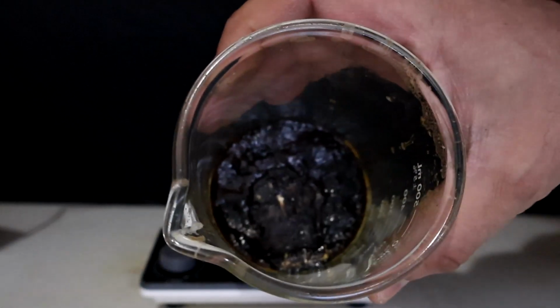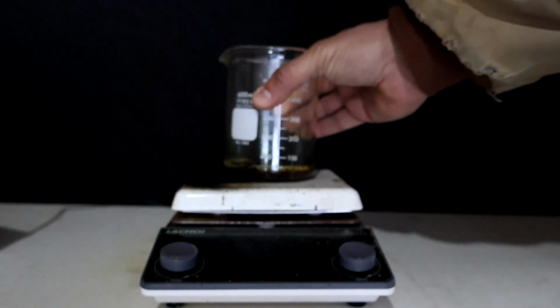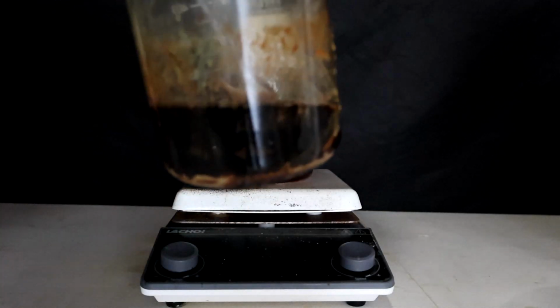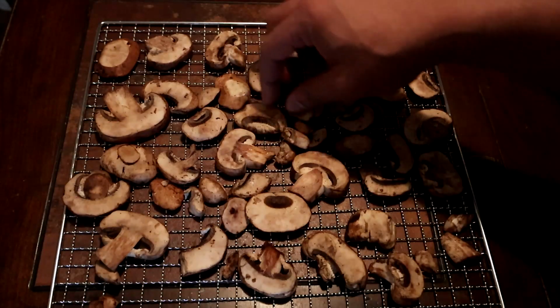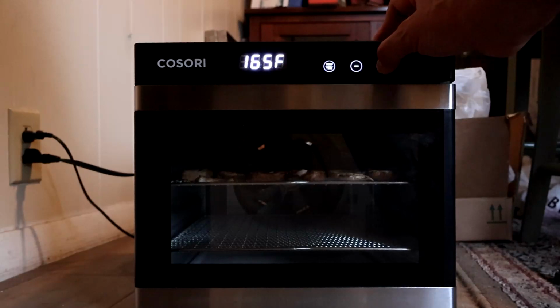This ugly organic carbon goo was left over. I redissolved this with DI water, centrifuged it, and we are now ready for analysis. The store-bought mushrooms were first dehydrated at 74 Celsius for an hour and were treated following the exact same process.